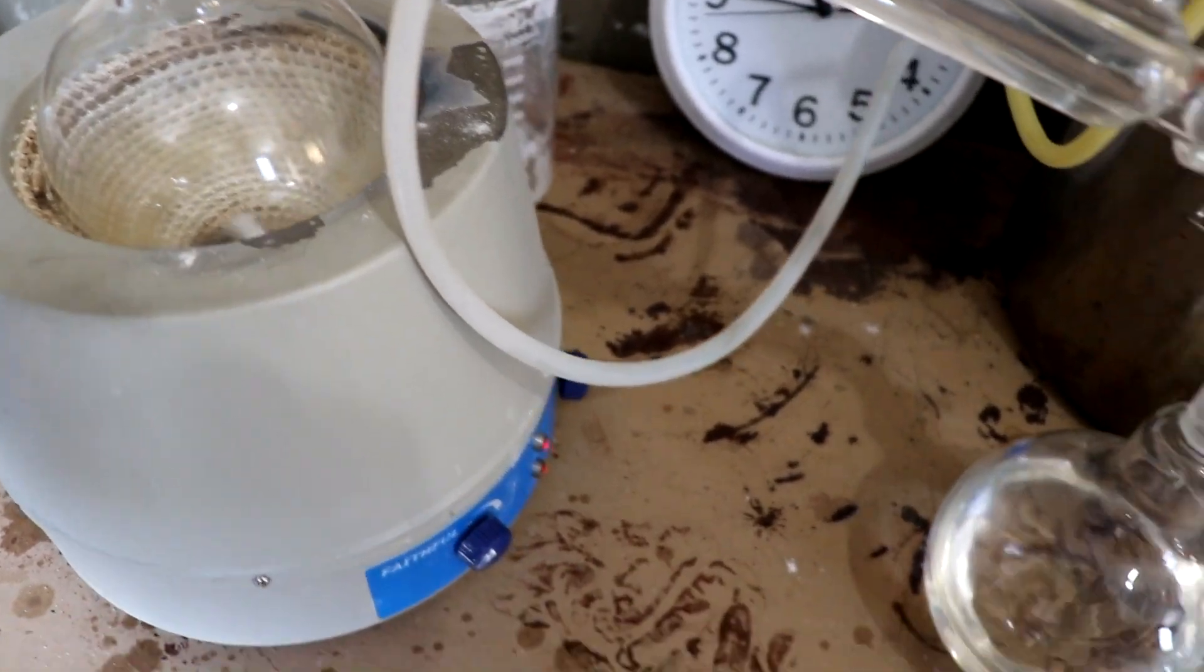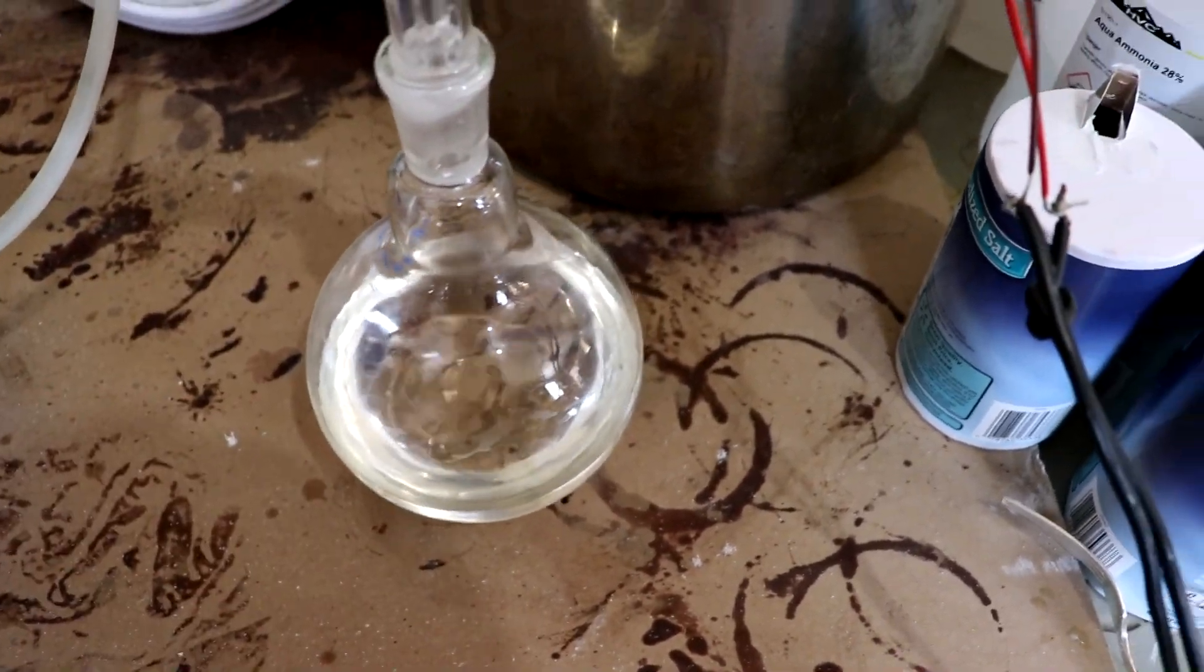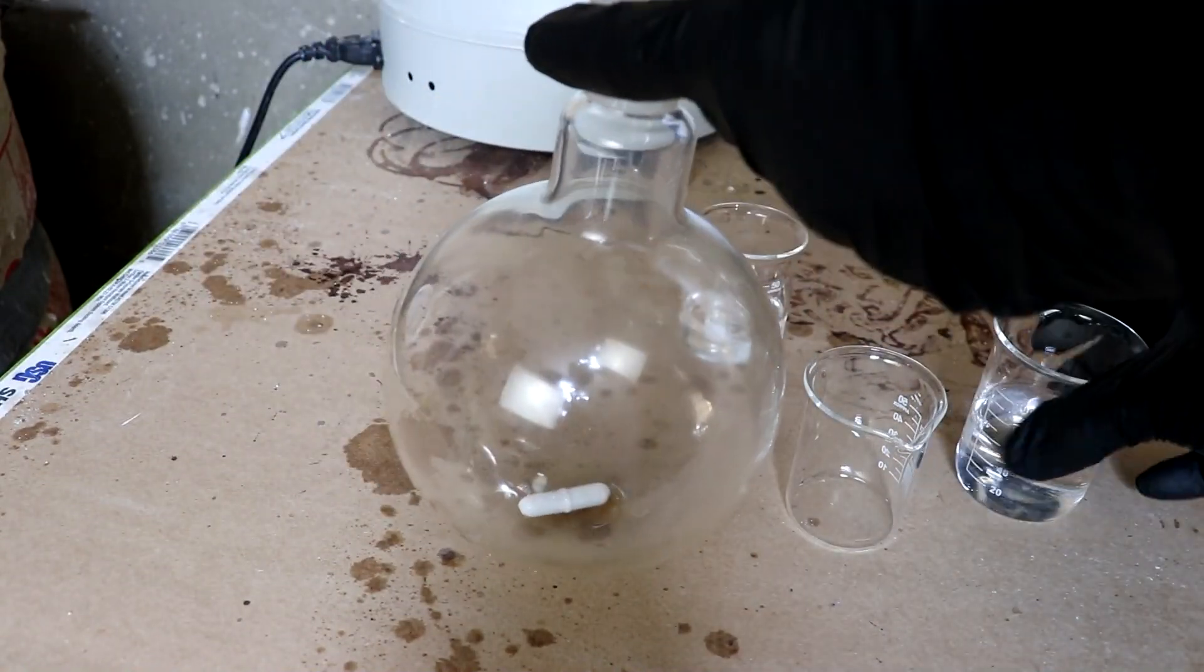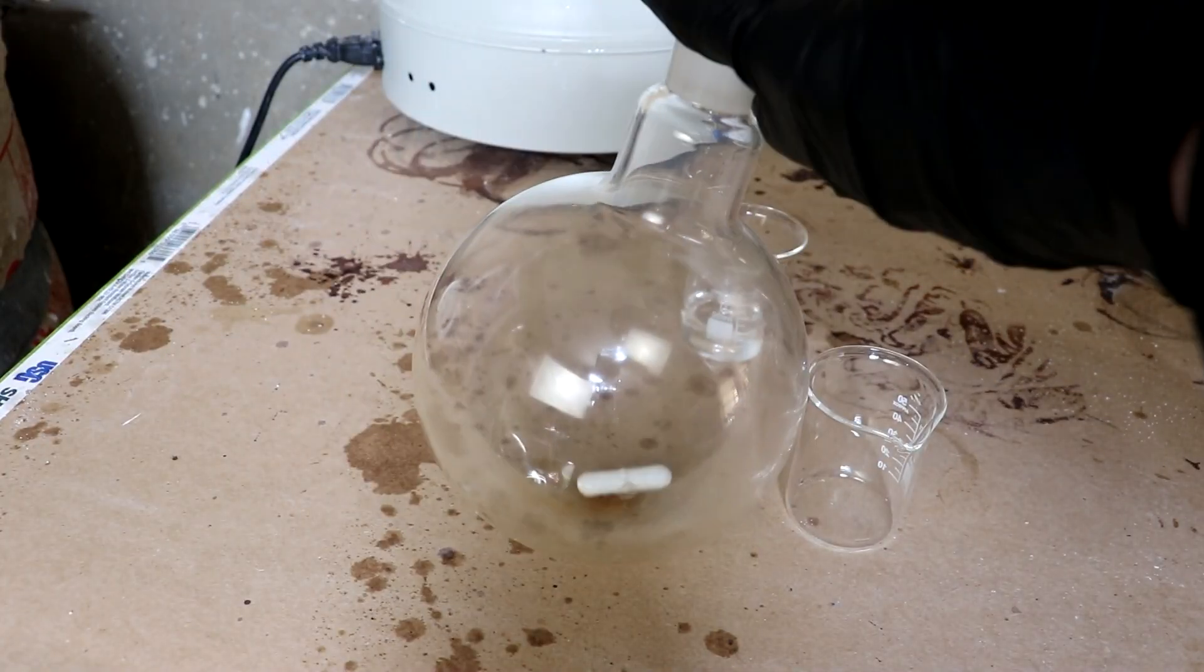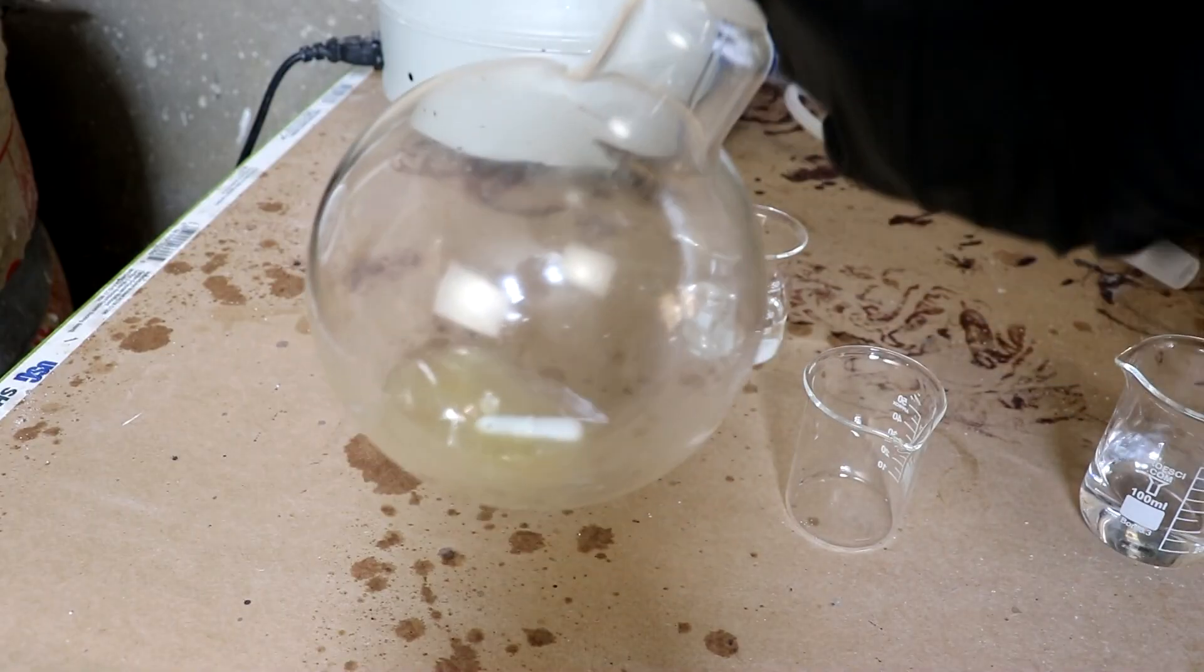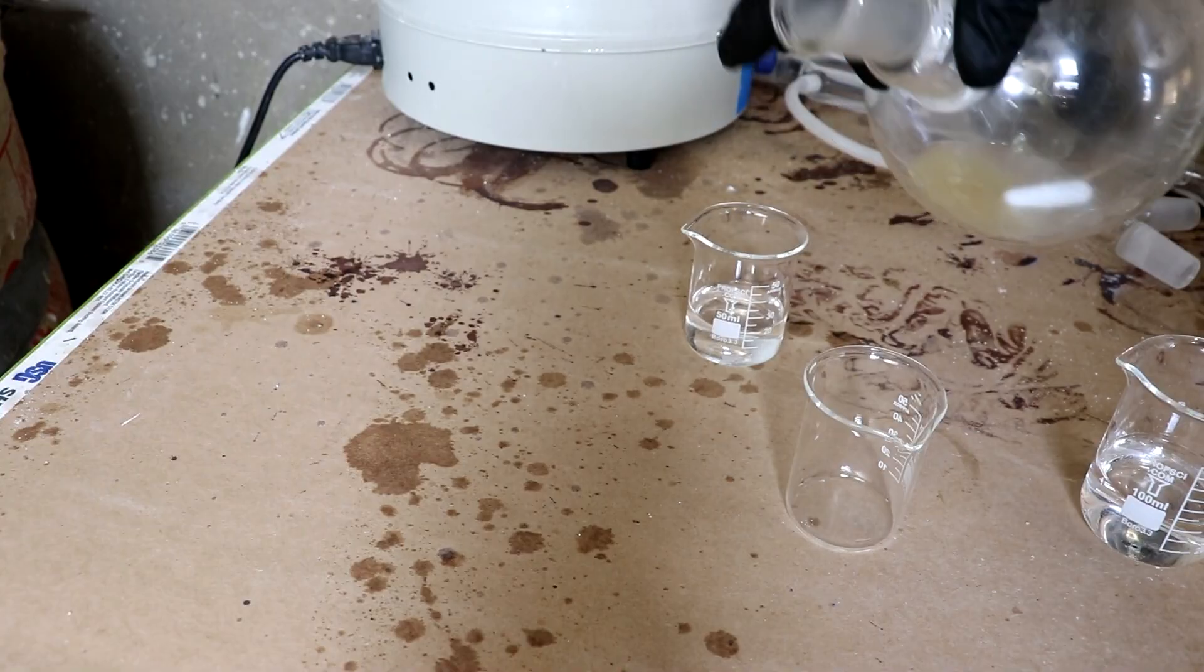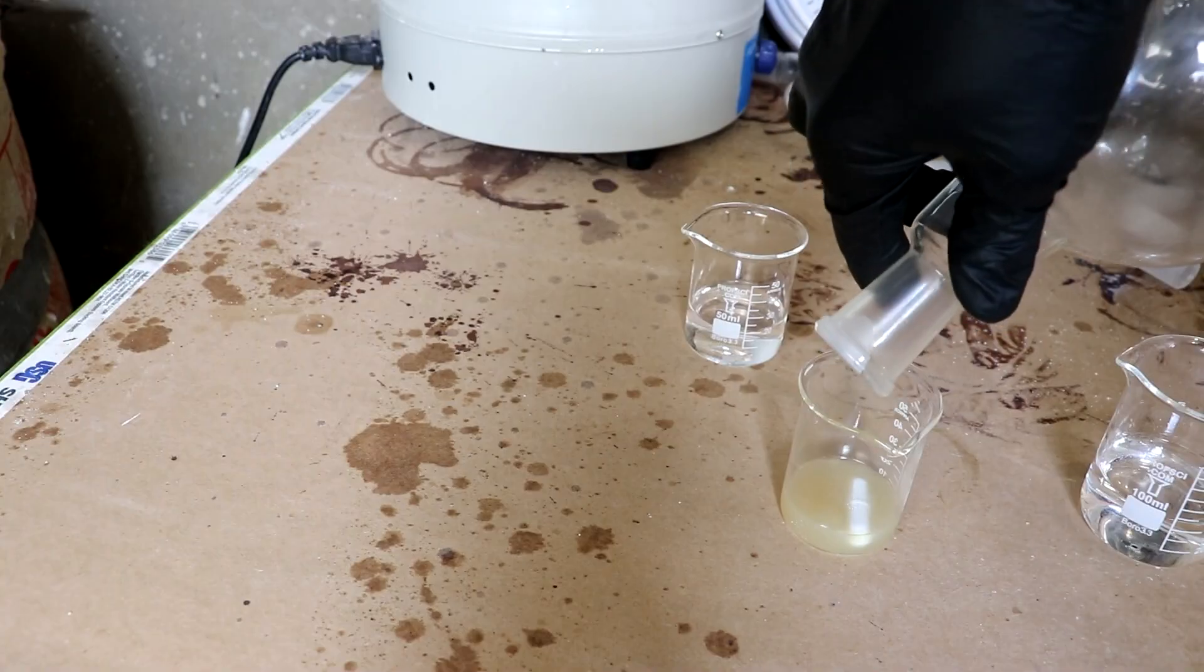There's my acetone. I've just done three of these. So now that I've got my hopefully concentrated iodine and all of the acetone has been evaporated off, I'm going to add some water to finish dissolving. Now to re-dissolve it, so that I can transfer it out of the vessel into a little beaker here. Excellent.